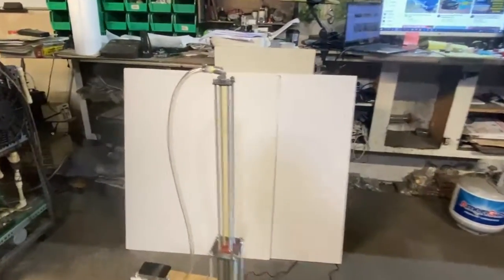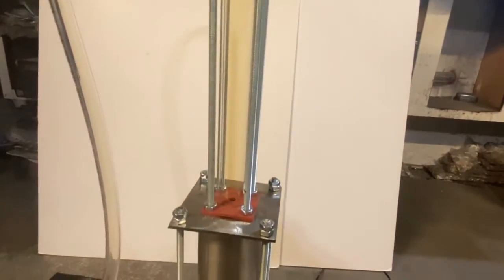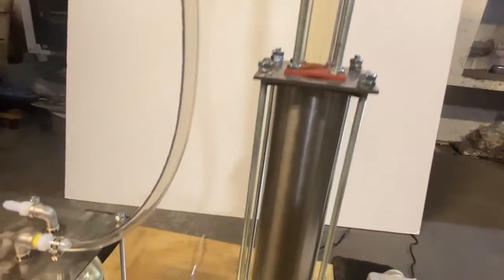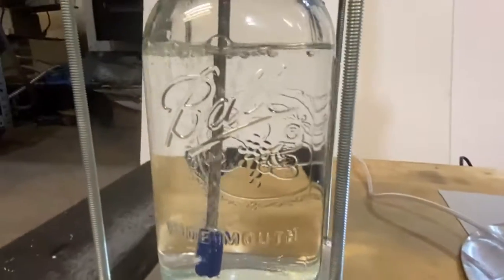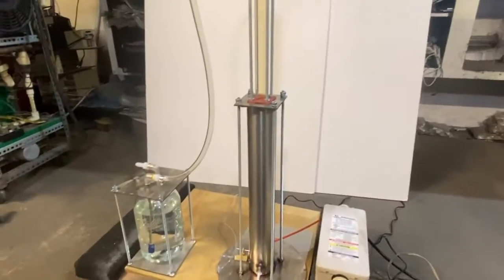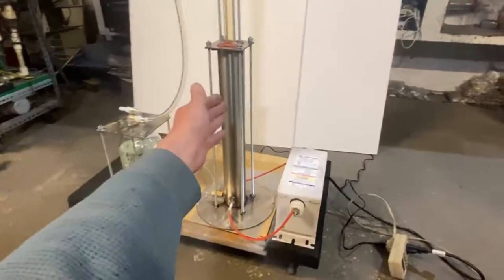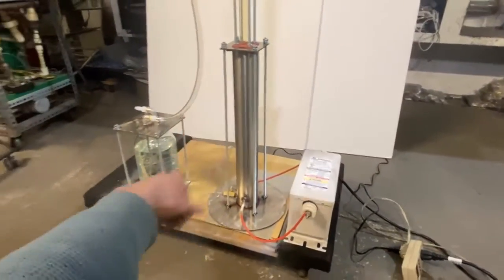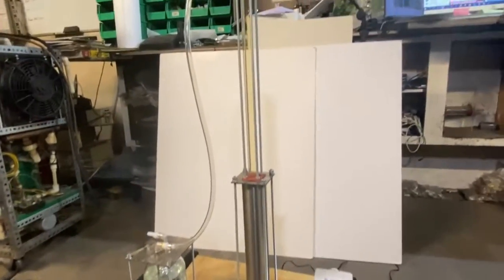So this is where we are. We've got the brown gas action. I've got a needle valve down here on the bottom to kind of limit the flow rate — we don't want to overdo it. This is all the time I had; I wanted to throw it together and see what it would do, because essentially this section here is acting as an oxygenation chamber based on just the way it's set up.